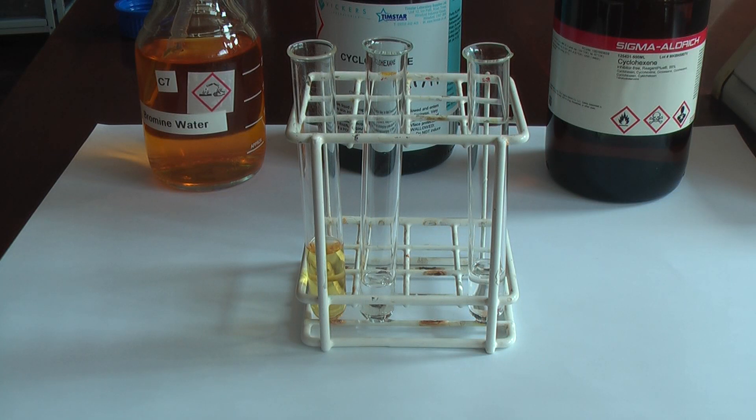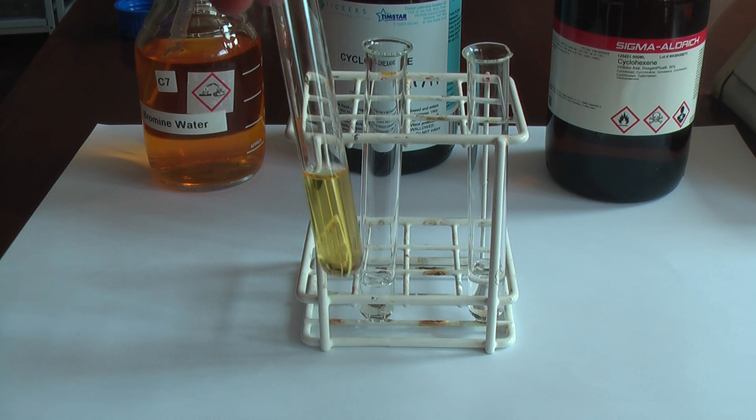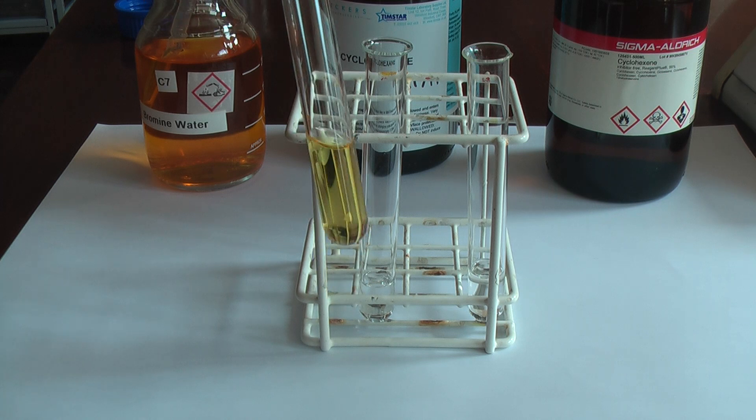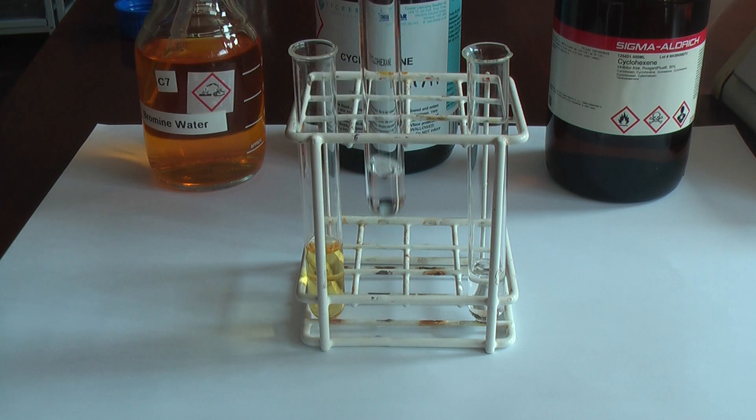Hello, I thought I'd just show you this quick demo of the reaction of bromine water with cyclohexane and with cyclohexene. So here we have the bromine water - it is quite clearly a kind of orange color.